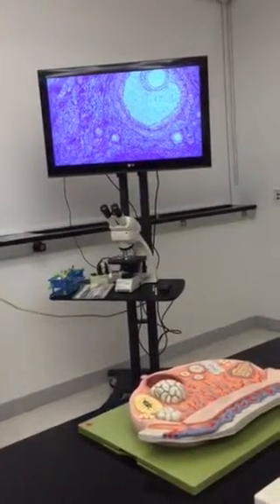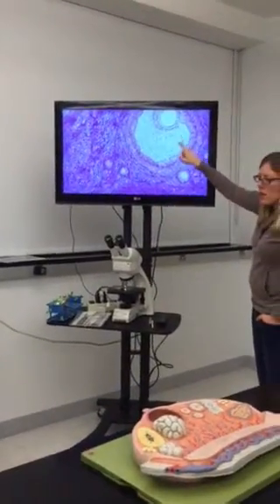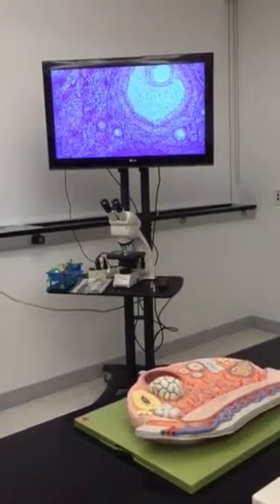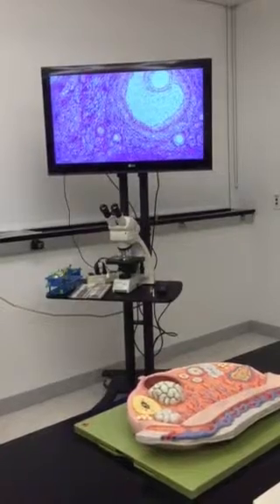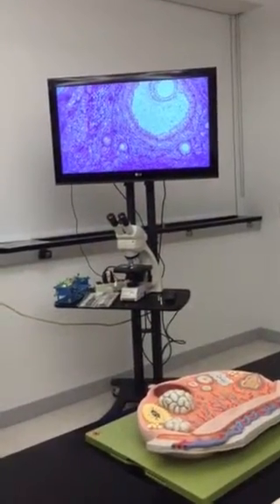Yeah, but you'll see this distinctive, kind of white background in between some of those simple cuboidal cells in a secondary. And you'll still see the oocyte in the middle. It'll just be fluid-filled spaces starting to form around it.